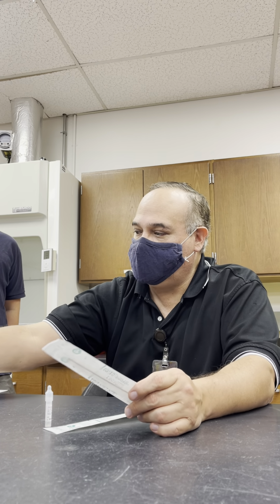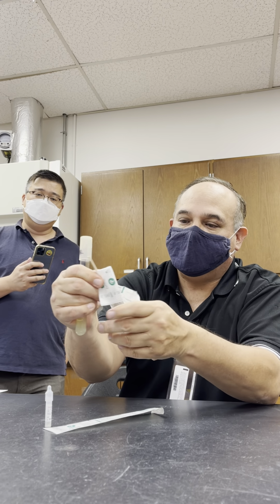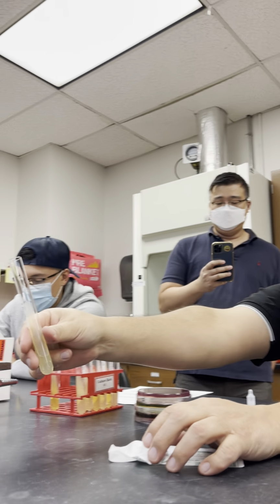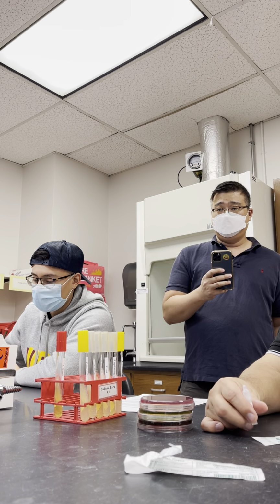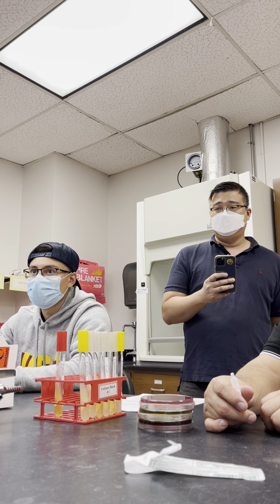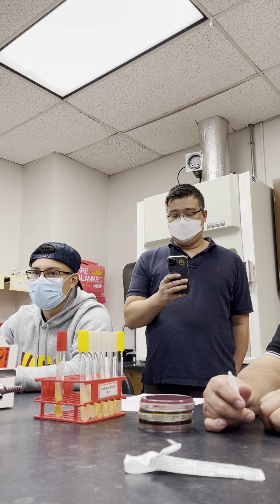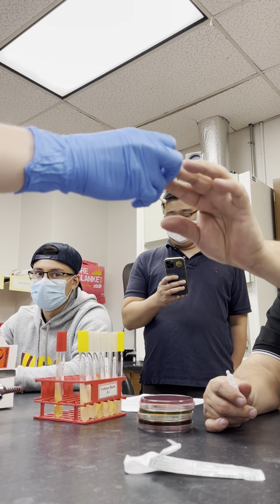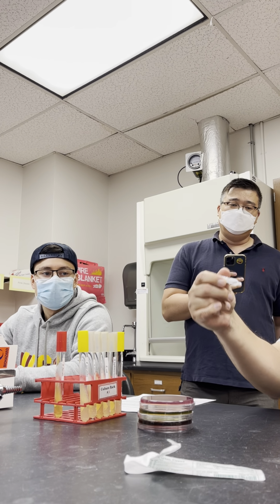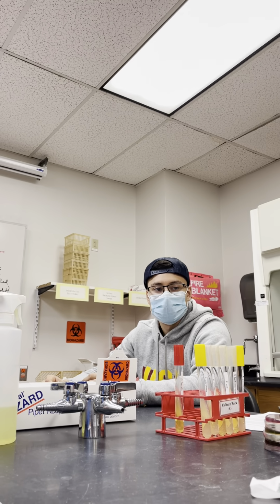So, Miss Carolina, will you please take this sterile cotton swab from the handle and go in there and get some of the organism for me, and then just give it to me after that. So just put it on the swab. I don't need to burn the top because it's a sterile swab, just get a little bit of the organism. Thank you. So can everybody see that the organism is on here? So now I'm going to take the reagent and put it on where the organism is.